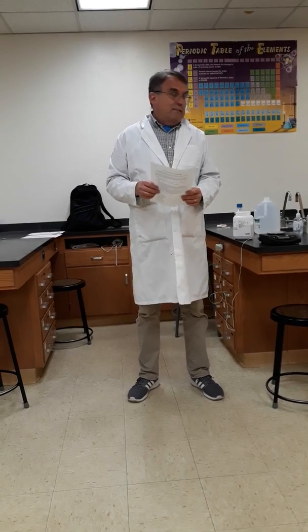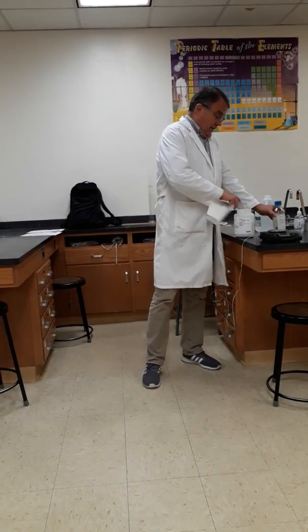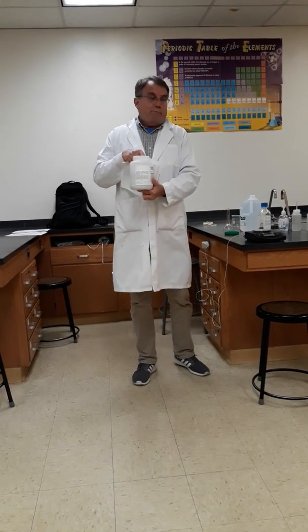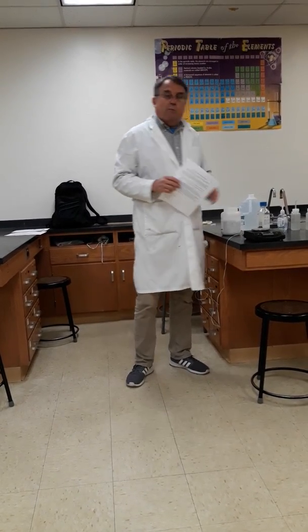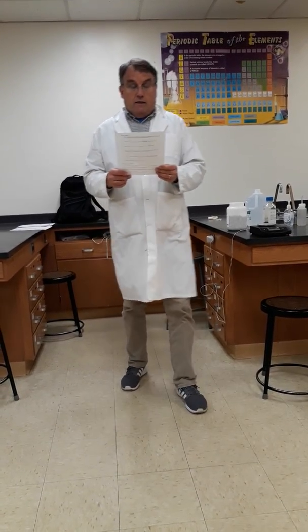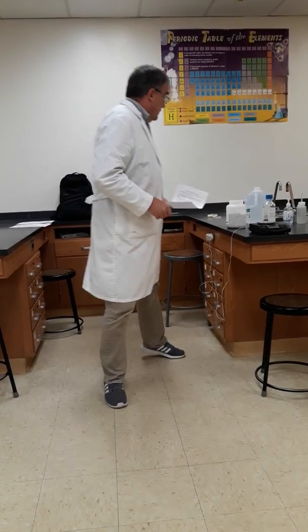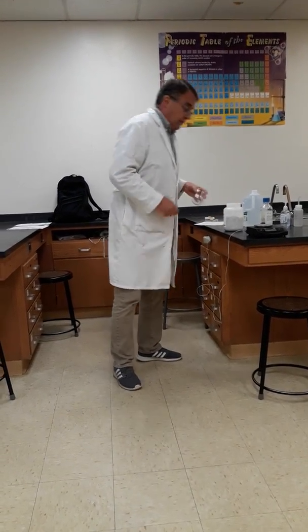We're going to be reacting hydrochloric acid with calcium carbonate. The acid will dissolve the calcium carbonate, and we'll be able to predict how much calcium carbonate will be dissolved. From here on out, we'll be calling the calcium carbonate marble chips, and it's just going to be easier to discuss them that way.